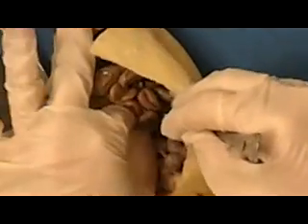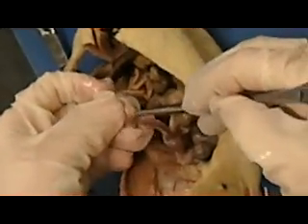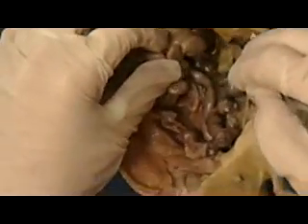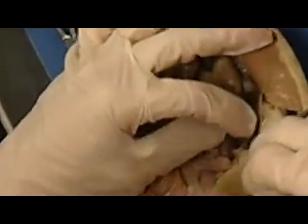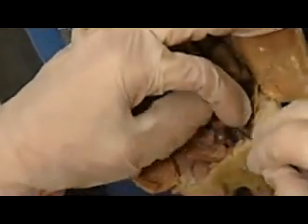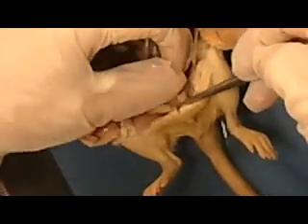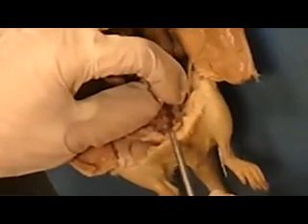If you were to take and detach this uterine tube from the back wall and feel the tip of it right there, you would feel a little knot. That knot is the ovary. So you need to make sure you know the female structures. And then the female's bladder, you'll find right in here, you'll see a little structure that sticks up. That is the urinary bladder.